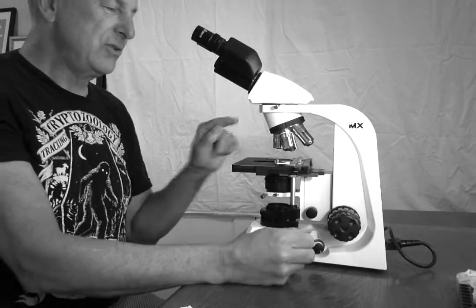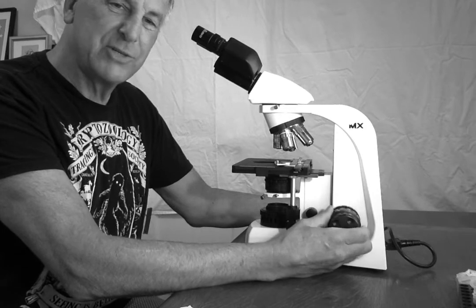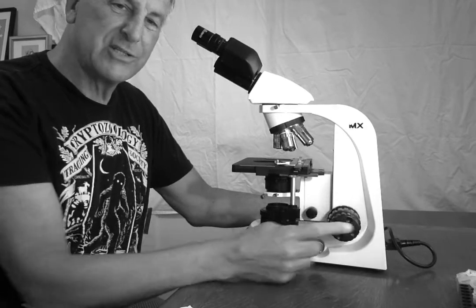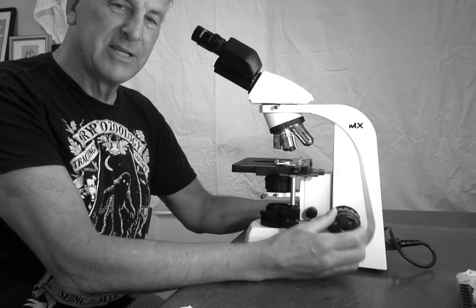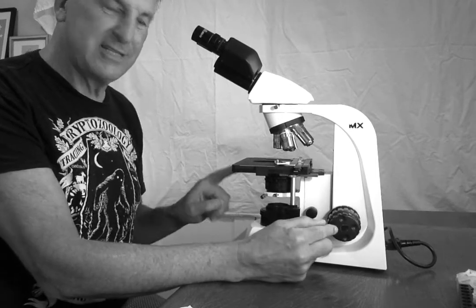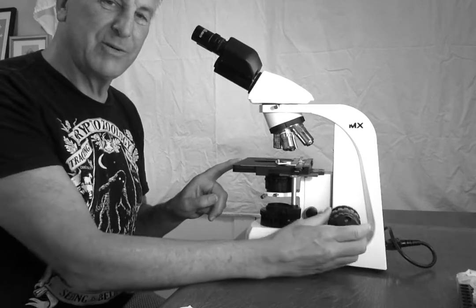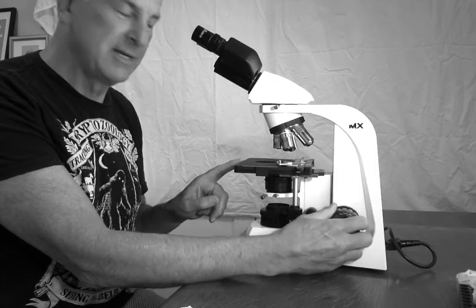When you do look through this one, it is the only objective in which you will turn the coarse focus knob. Here are the focus knobs. They're on both sides of the scope. This is the fine focus. You can see when I turn it, you cannot see the stage moving up and down, but when I move the coarse focus, it moves pretty significantly.